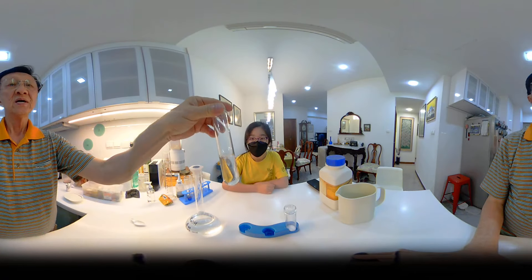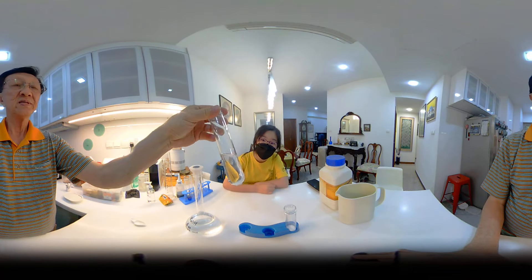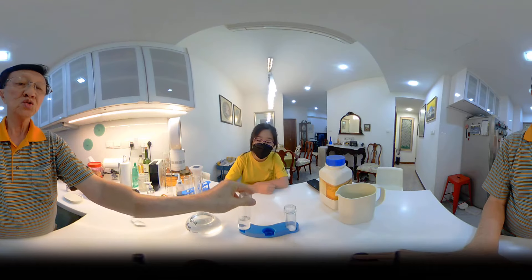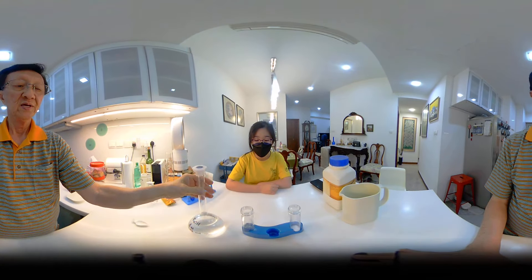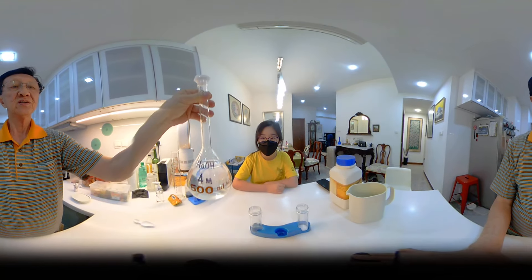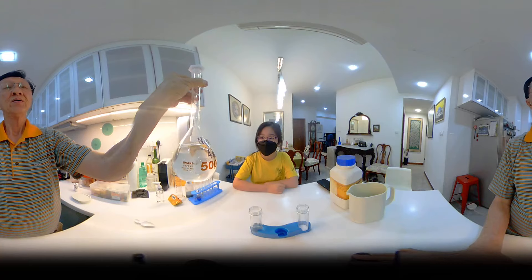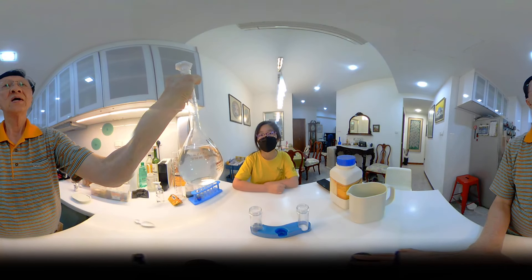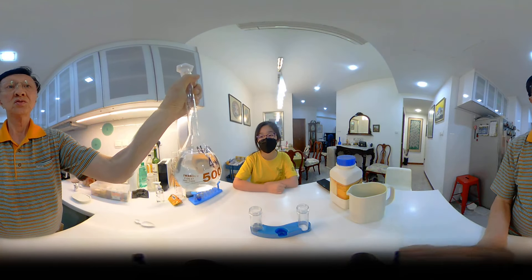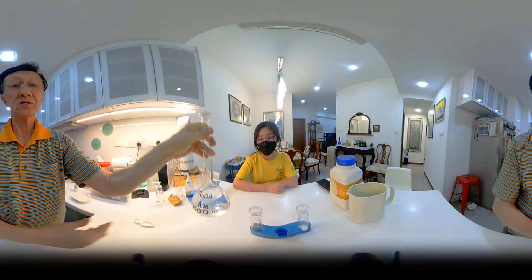This is a plastic test tube containing sodium hydroxide. This is your sodium hydroxide, which is a 4 molar solution, NaOH.